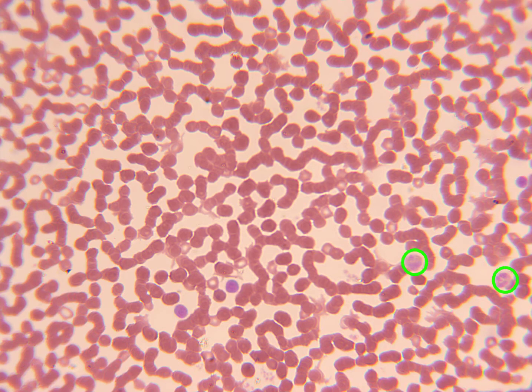And you can see that polymorphonuclear shape of the nucleus within the neutrophil, and you can see that it has multiple lobes. And you can see that the neutrophil in general, especially the cytoplasm, has a very light pale stain to it.